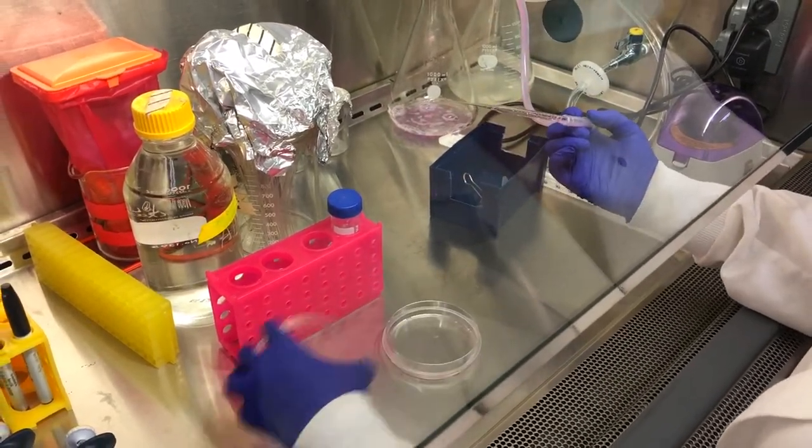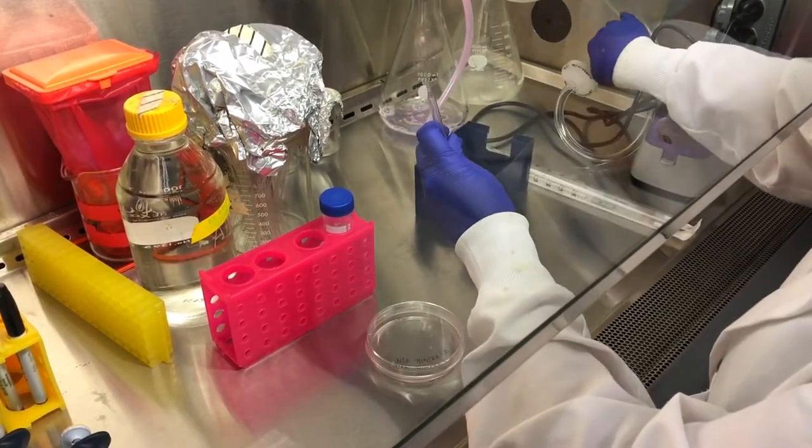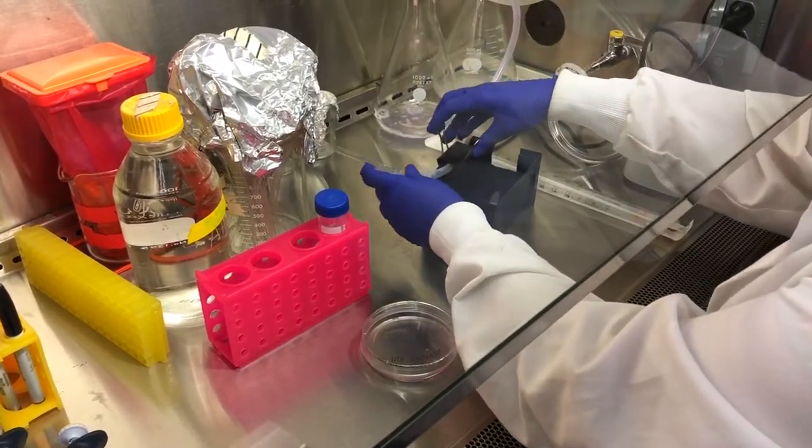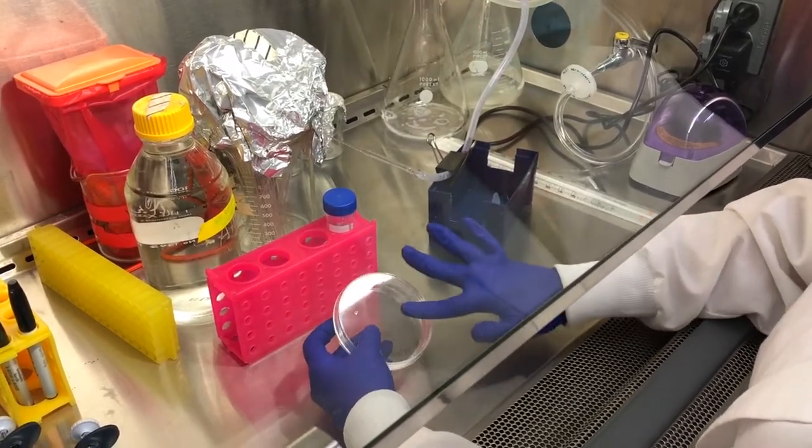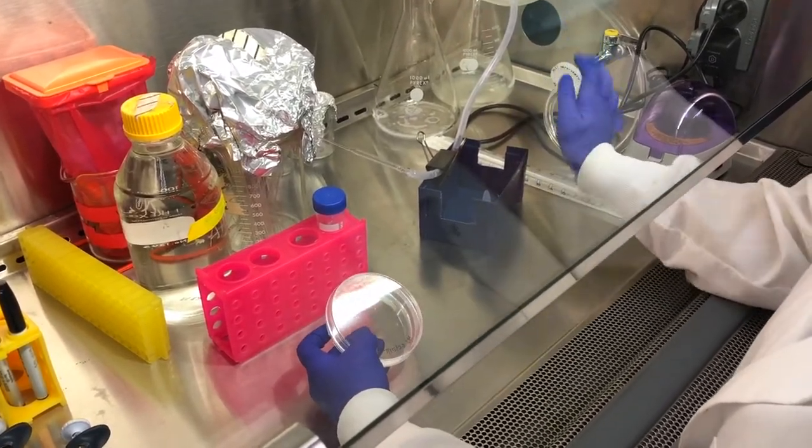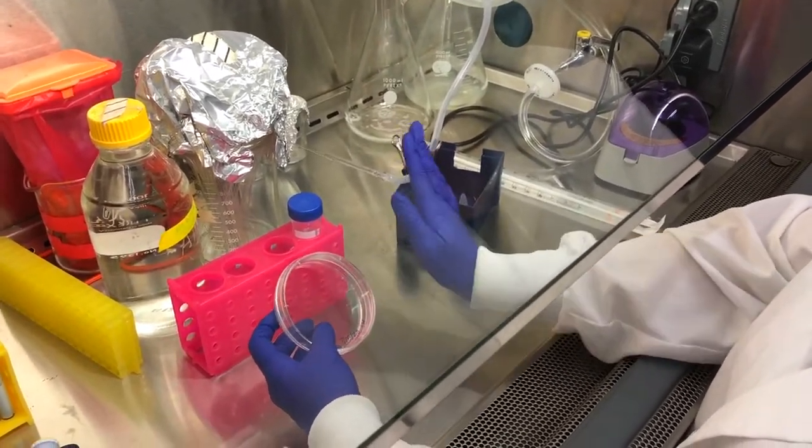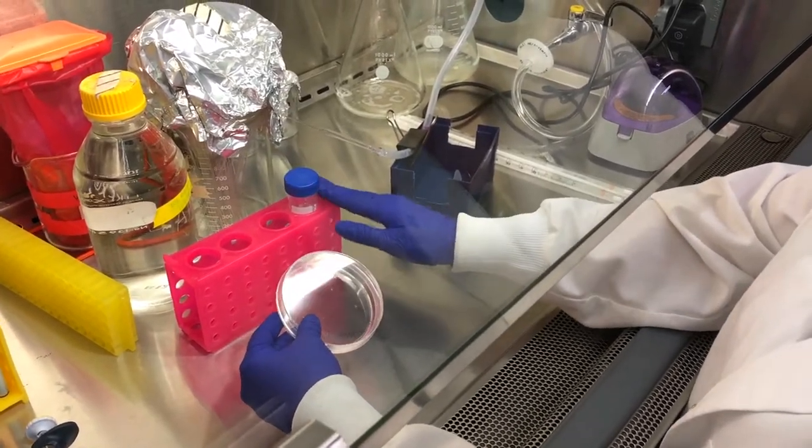So now that your media has been aspirated, you're next going to resuspend your cells. And there's a layer of cells at the bottom. So all you need to do is use your pipette and you just want to basically attack your cells gently with this fresh media.